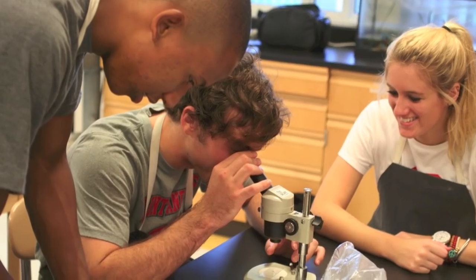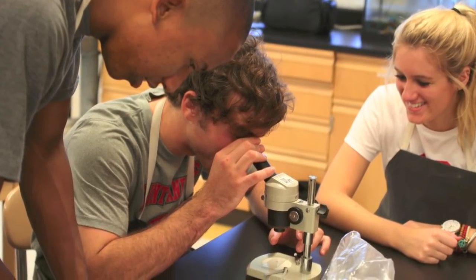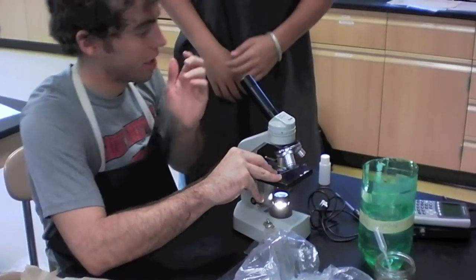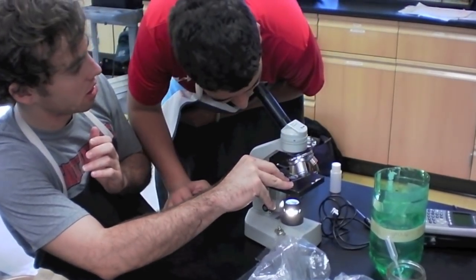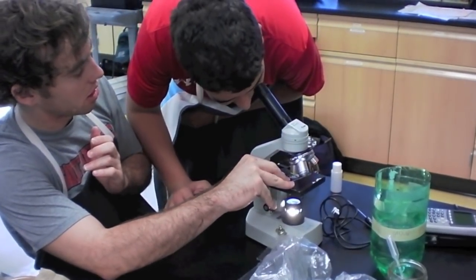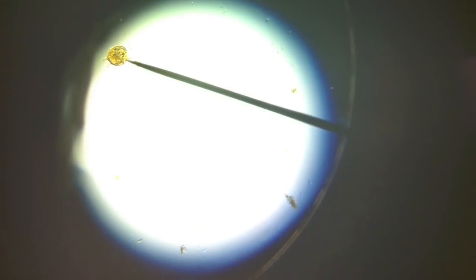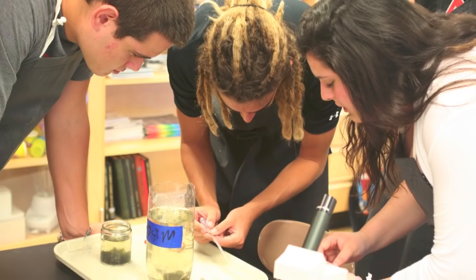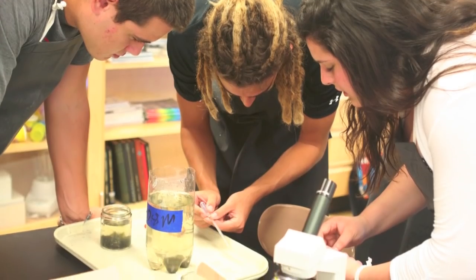We'll be starting with using our microscopes to actually do a study of the biodiversity within the pond — what sort of things do we have, and do we see the variety that we're looking for in a healthy pond ecosystem?